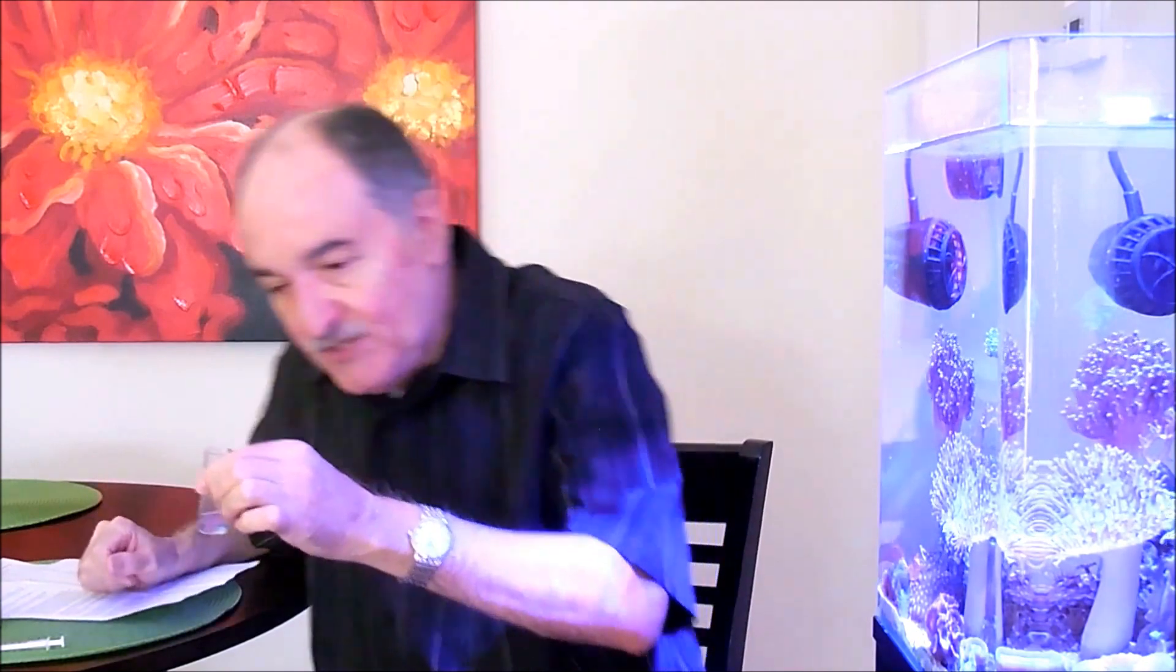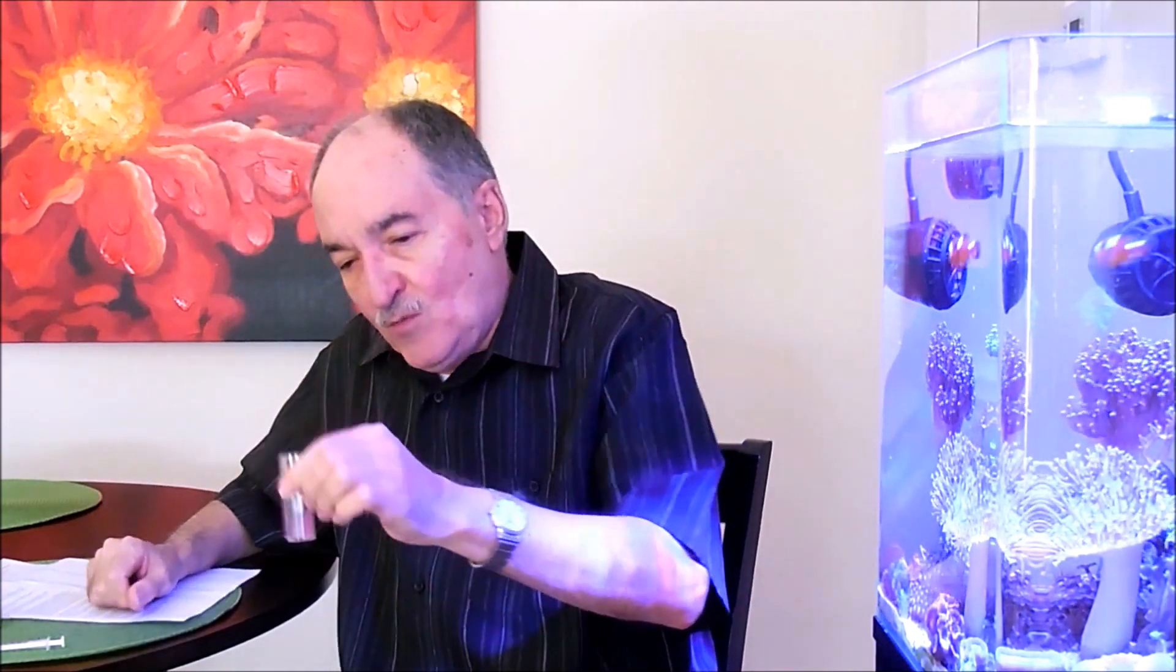Remember, you're supposed to swirl it, not shake it. If you notice, it's got like a reddish-pinkish color.